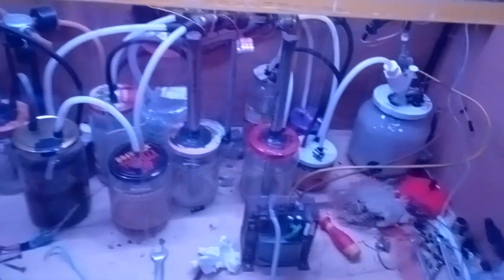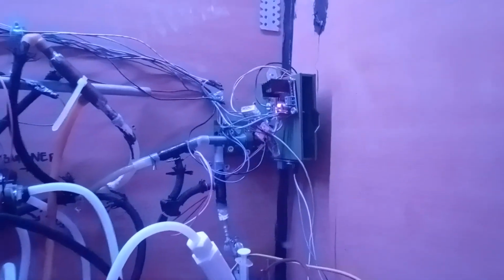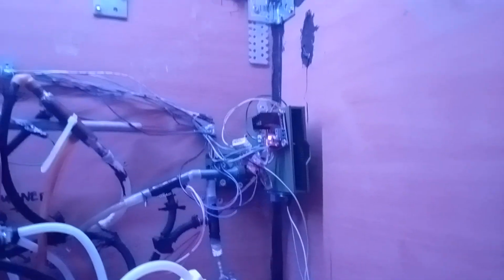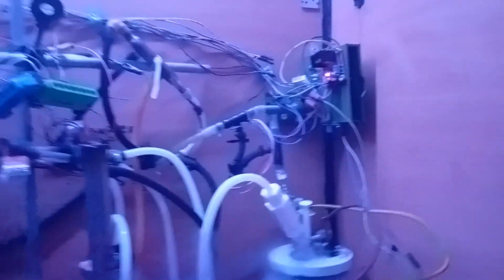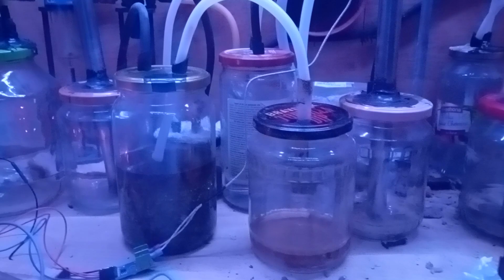Ladies and gentlemen, Mastringer here, and I'm back in the basement, and you can see here behind this spot the good old flow system, and you can hear it wiggle around for some reason.